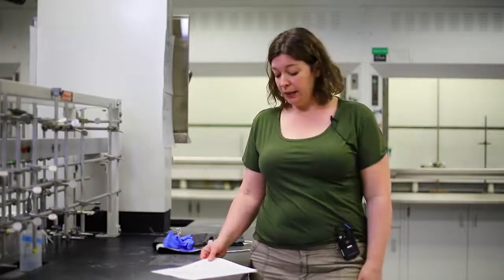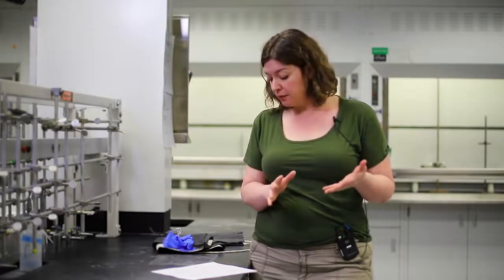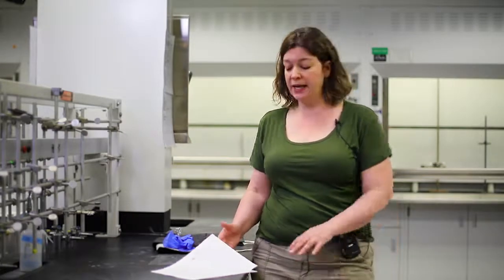There are 2 main classes of hazard that you're going to see in a chemistry lab or in other science courses. We have physical hazards, and these include things that are flammable or combustible, things that are explosive. We also include corrosive materials like acids and bases in physical hazards. And then we also have chemical hazards. Chemical hazards include toxins, irritants, and carcinogens in the worst case scenario.